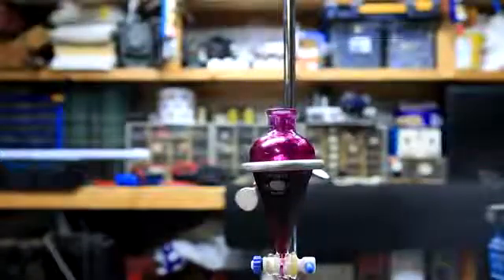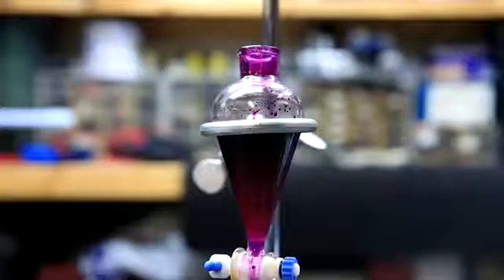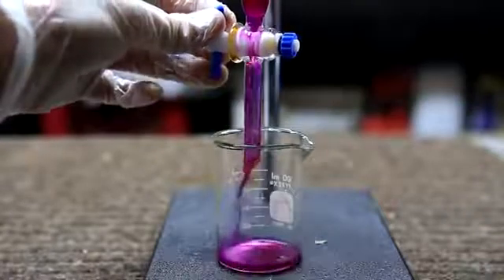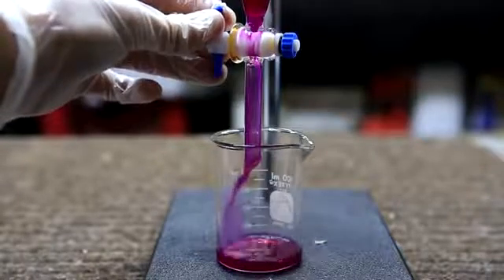And for one final time, the separatory funnel is capped, shaken, and vented, and then the layers are allowed to separate. Even after leaving it for a while, the layers will be very hard to see, but they are there. The lower layer, which contains some phenolphthalein but mostly unreacted phthalic anhydride, is drained.